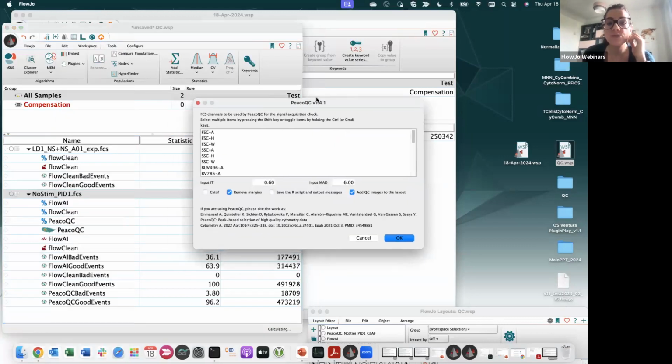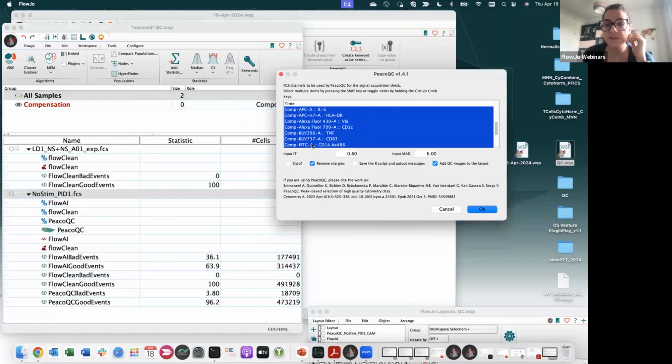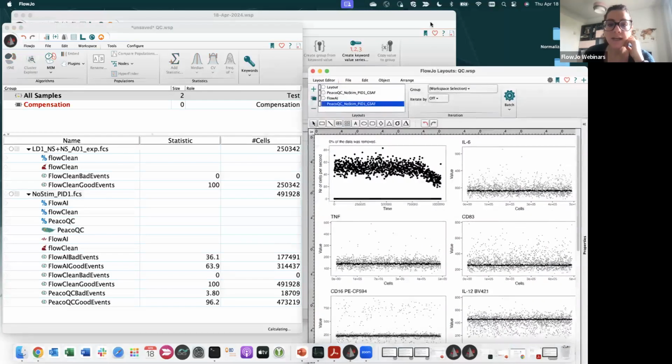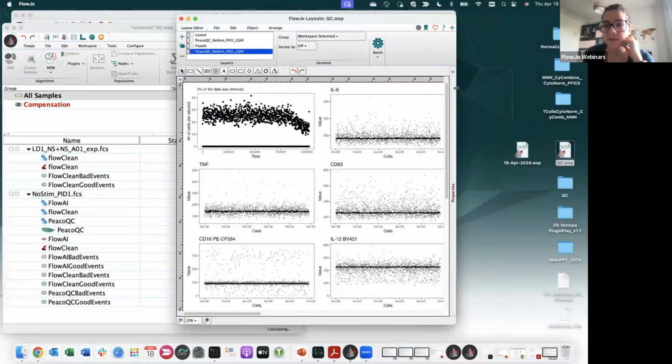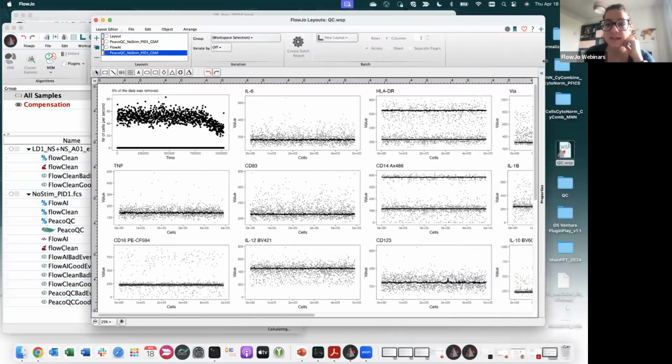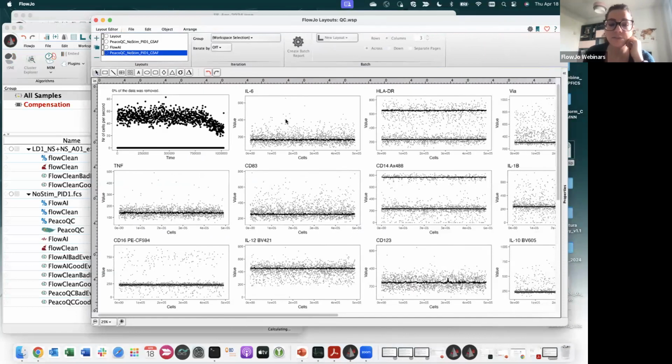Okay, and when you run it, you will be prompted as well with the selection of the correct parameters right here. You can select if these data are coming from CyTOF or not, and you can also choose to add QC images to the layout, which is what I did basically. So when I look at my output, this is the output that I got from PeacoQC automatically in my layout.